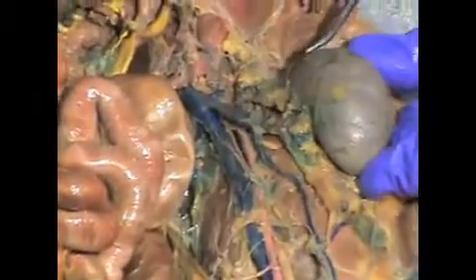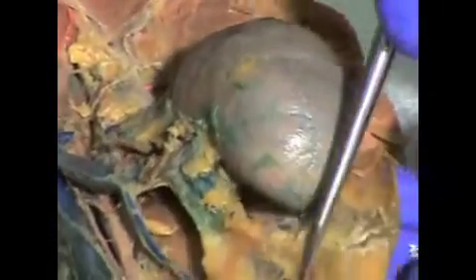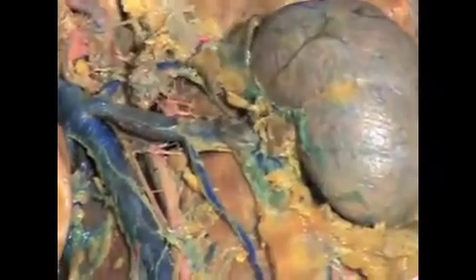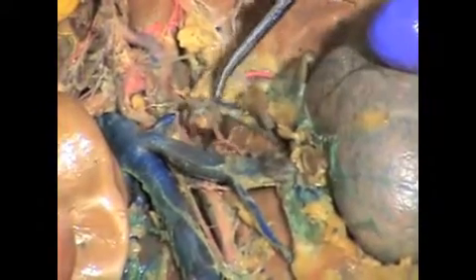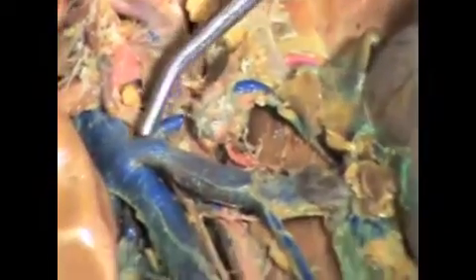First we see the kidney, the left kidney found here. Get a close-up view of that kidney. And the renal vein is coming into the kidney right there. And this little bean-like structure right there is the cat's adrenal gland. So the adrenal gland has this vein that lies across the top. It's been broken in this specimen, but that is the adrenal gland found right there.